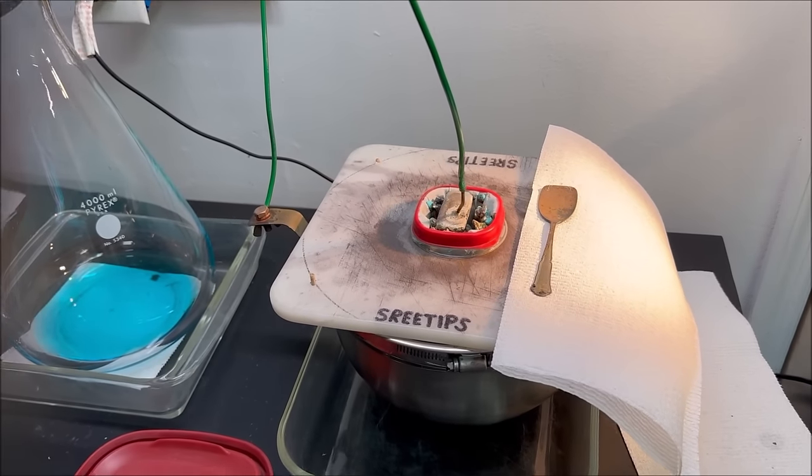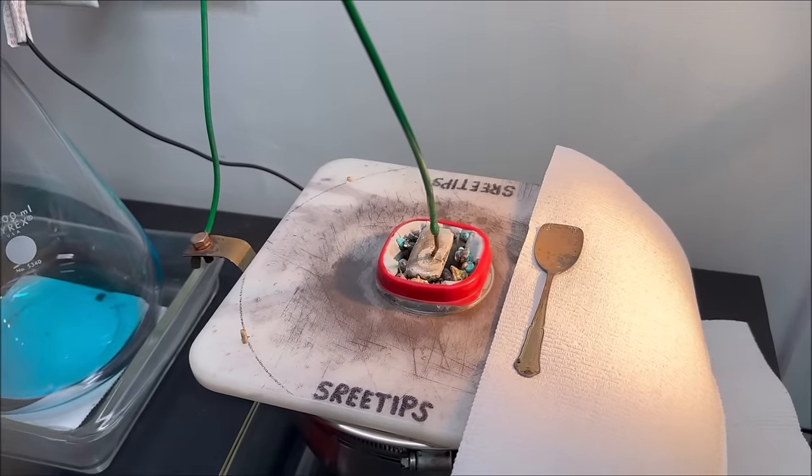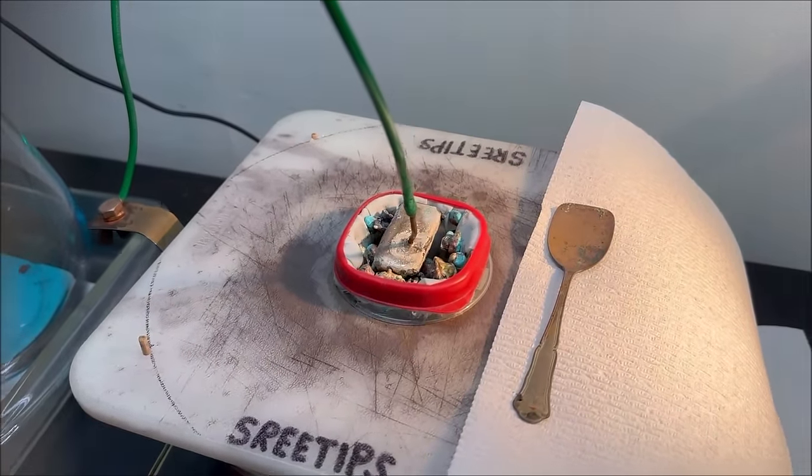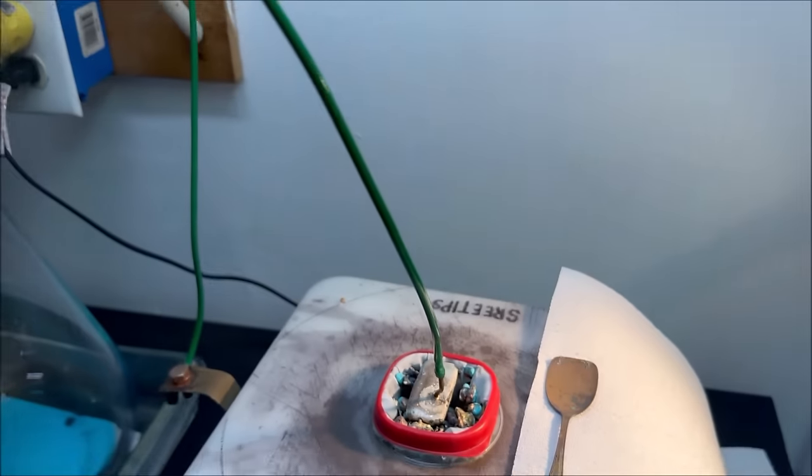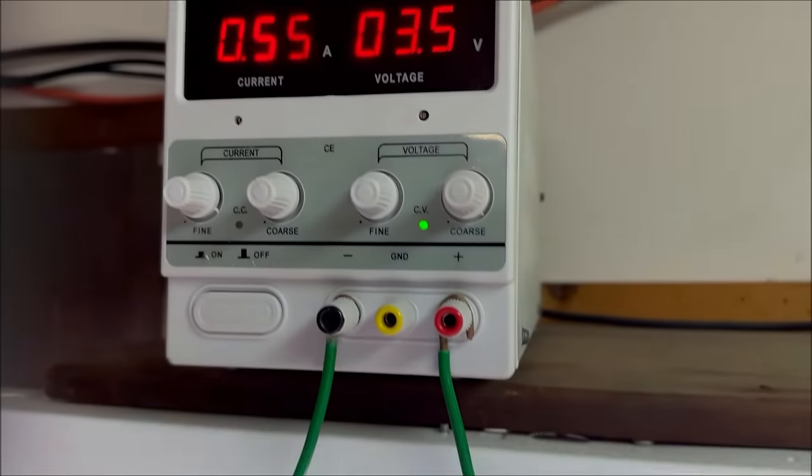Good morning everybody, Sreetips here. It's the morning after I've got my silver cell placed back in operation. You can see some of that silver has been consumed by the electrolytic action.